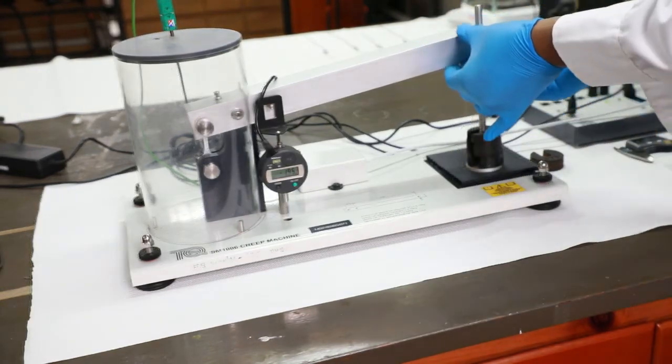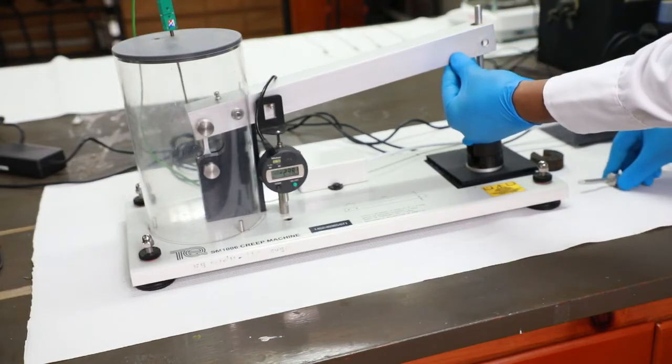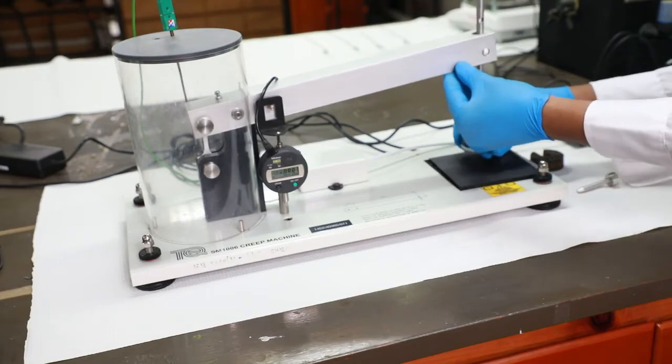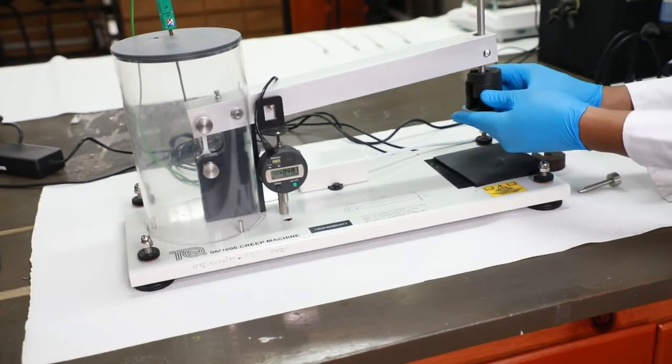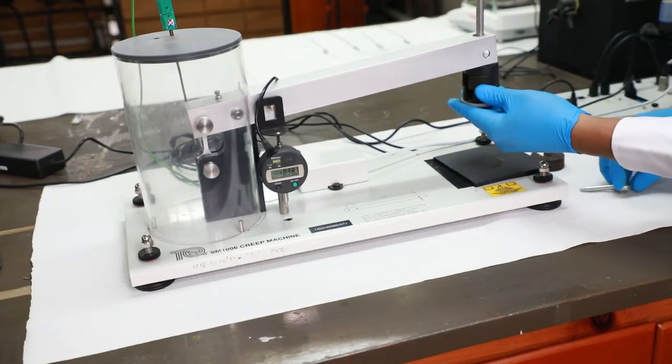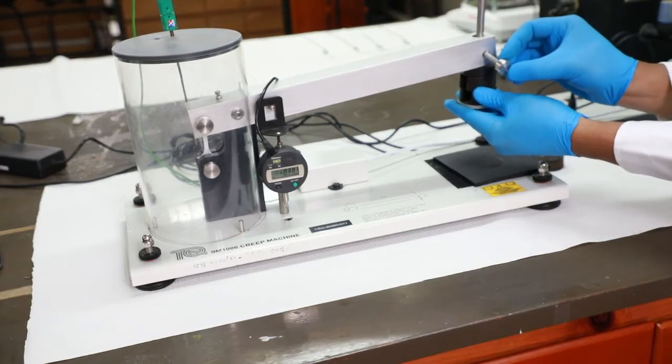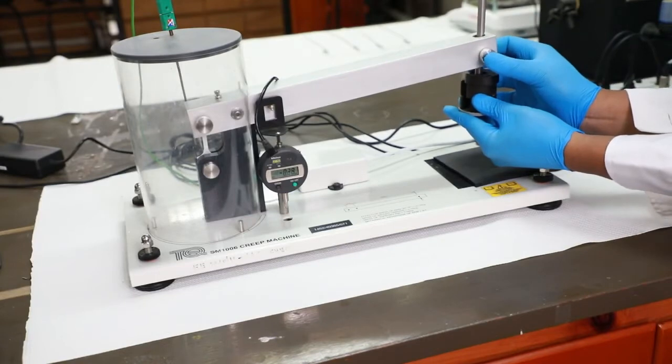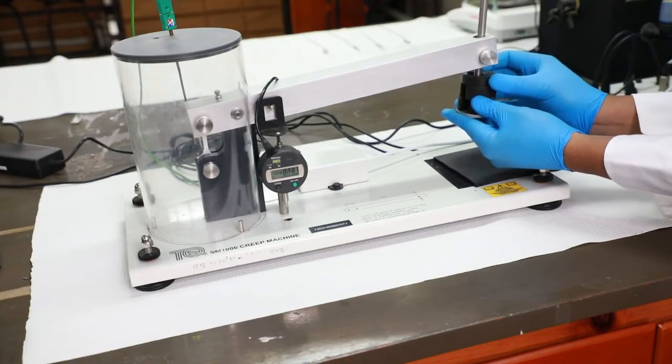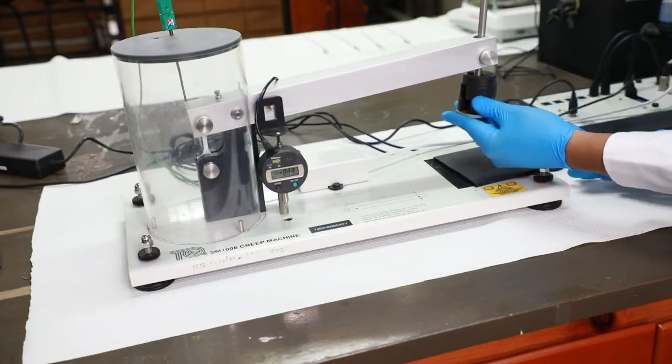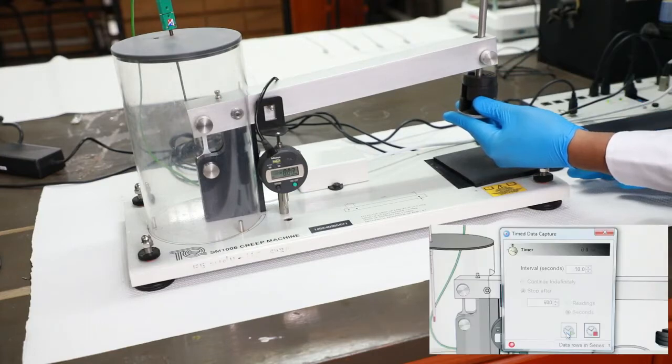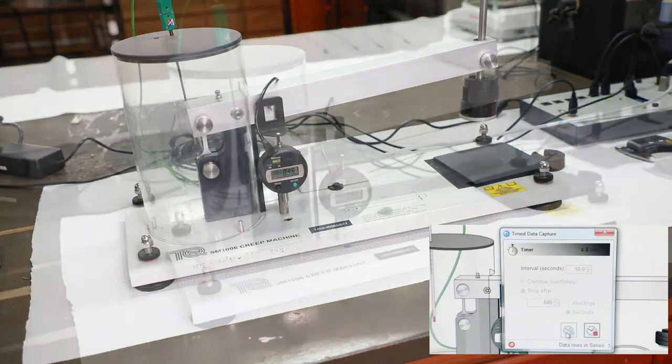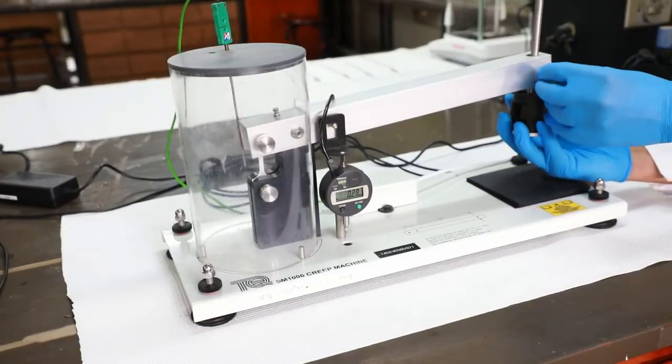Raise the lever arm and secure the pin. Start recording data on the computer simultaneously. Release the lever arm.